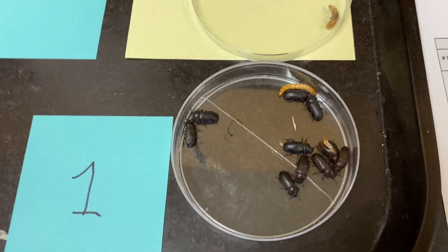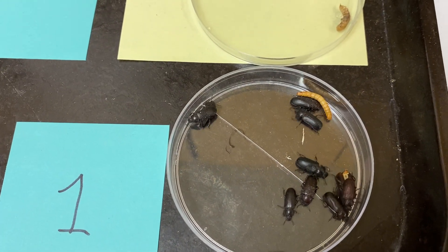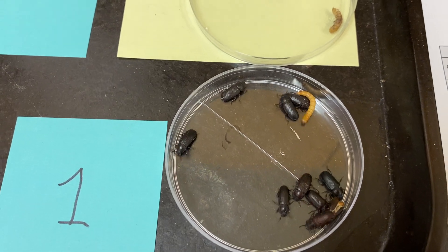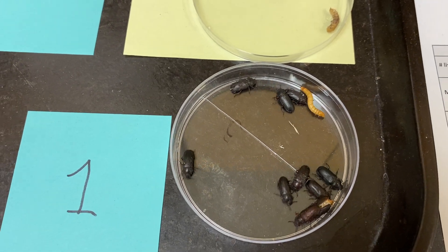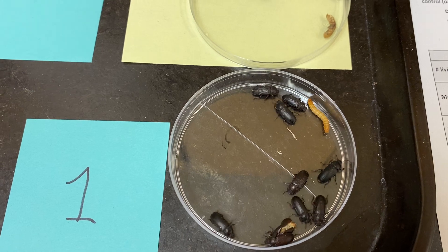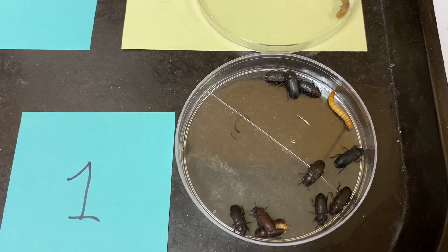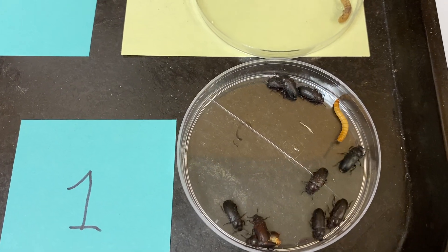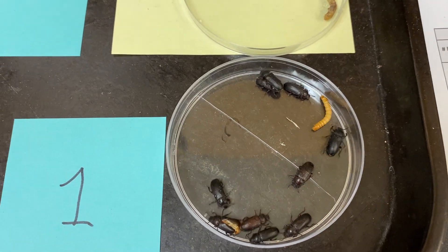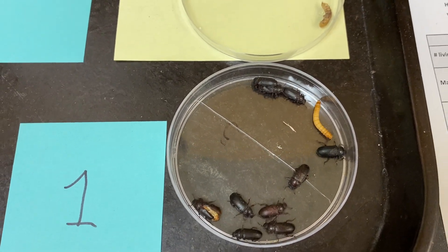Control colony number one — you can see we have a total of eleven organisms. Keep in mind there are mealworms as well as adult beetles. Do not count them separately; just record the total number. So go with eleven for control colony number one.